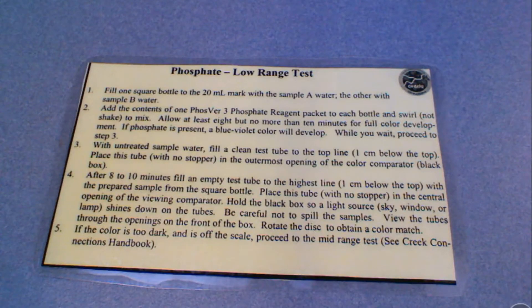Just a reminder: when you're in the field and you don't have access to these videos, you do have printed instructions, so be sure to always follow along with each of the instructions written there. If you have a question, please ask your instructor.